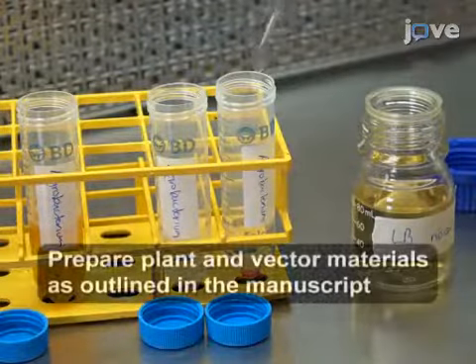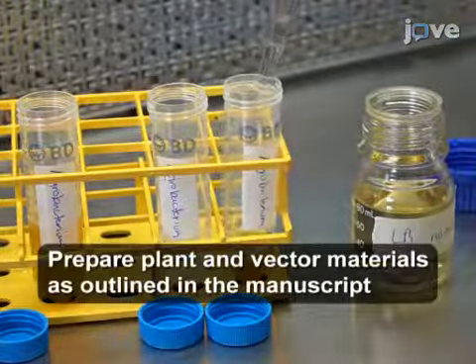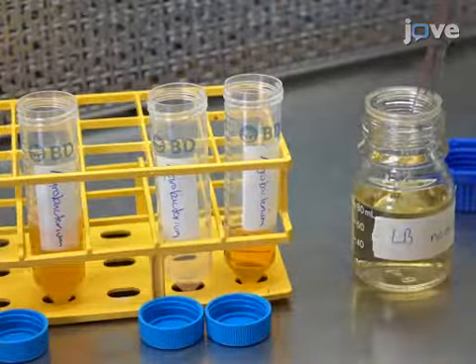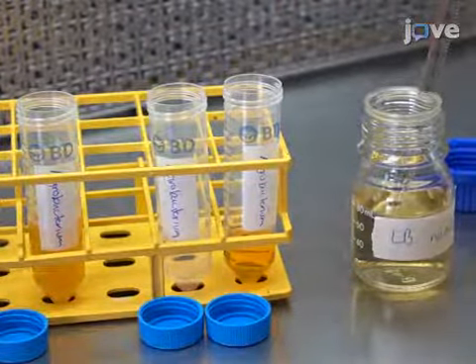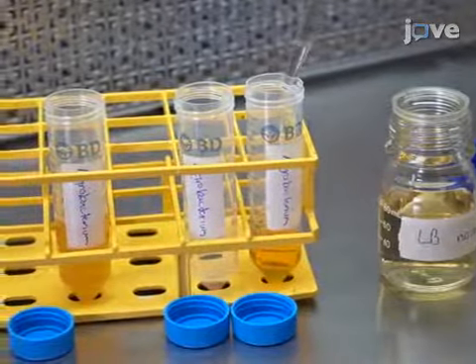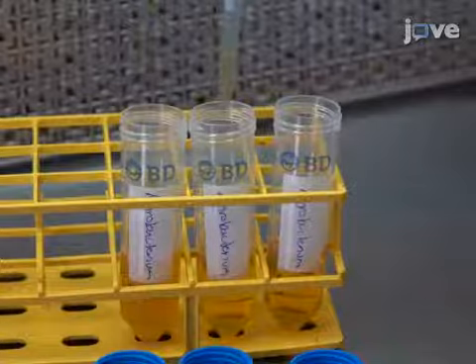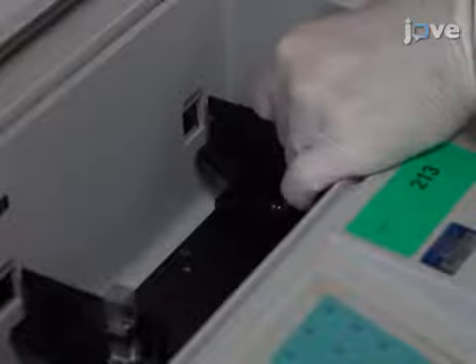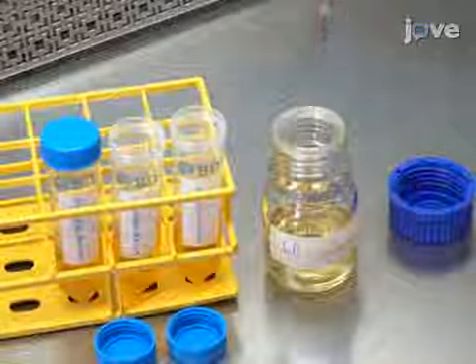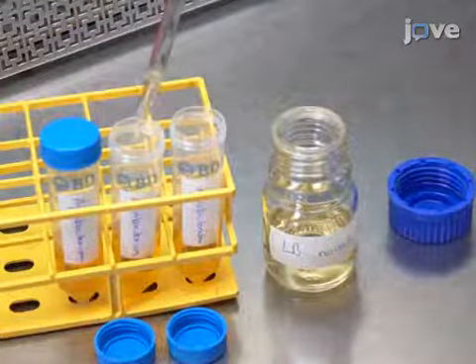To begin, prepare a clean 50 millilitre screw cap tube with 19 millilitres of fresh 28 degrees Celsius LB medium with the appropriate antibiotics for bacterial selection. Add one milliliter of A. tumefaciens culture and check the optical density, or OD, at 600 nanometers. If the OD is above 0.1, dilute further with warm LB.